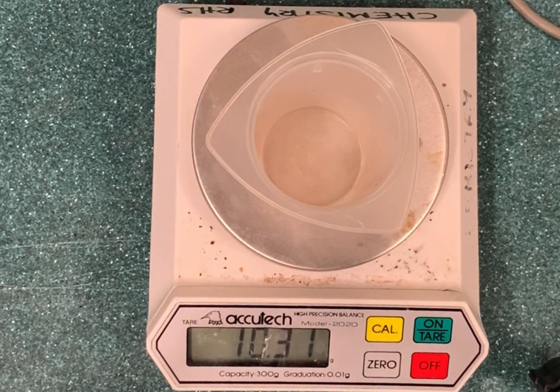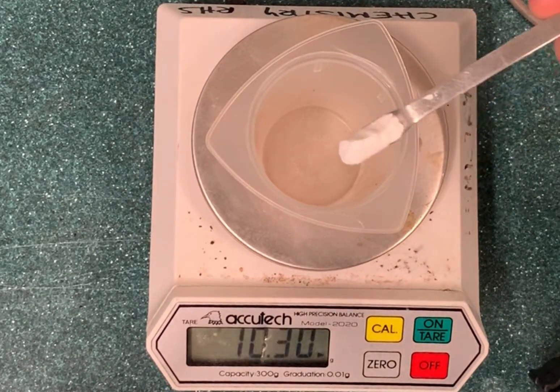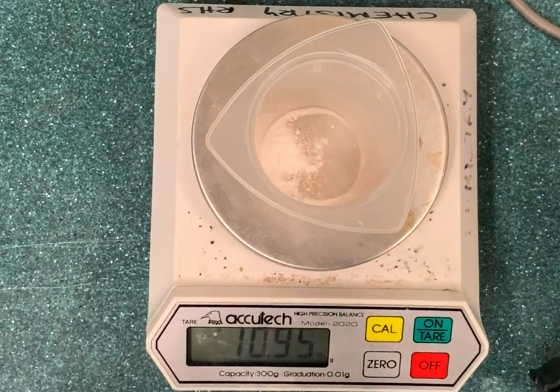You can then put into your beaker the solid which you're trying to weigh out and write down the mass of the beaker plus the solid. When you've then used the solid from the beaker, you can re-weigh the beaker to find out what residue is left, and this allows you to know how much of the solid you've actually used for your reaction.